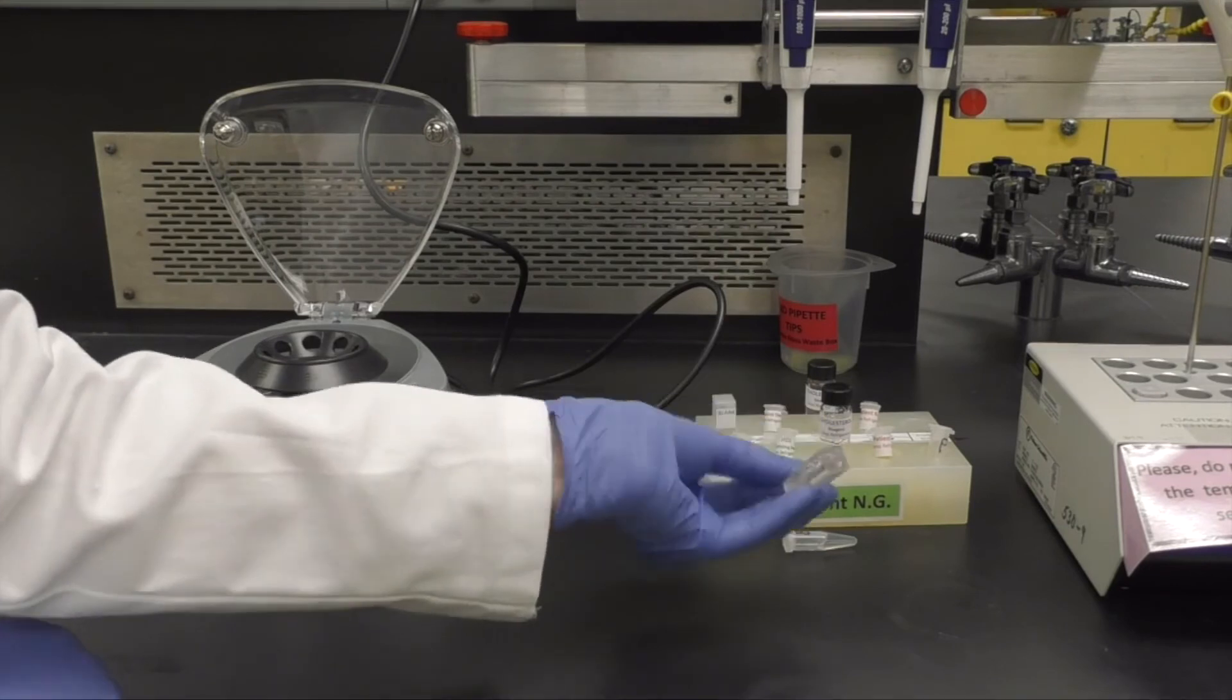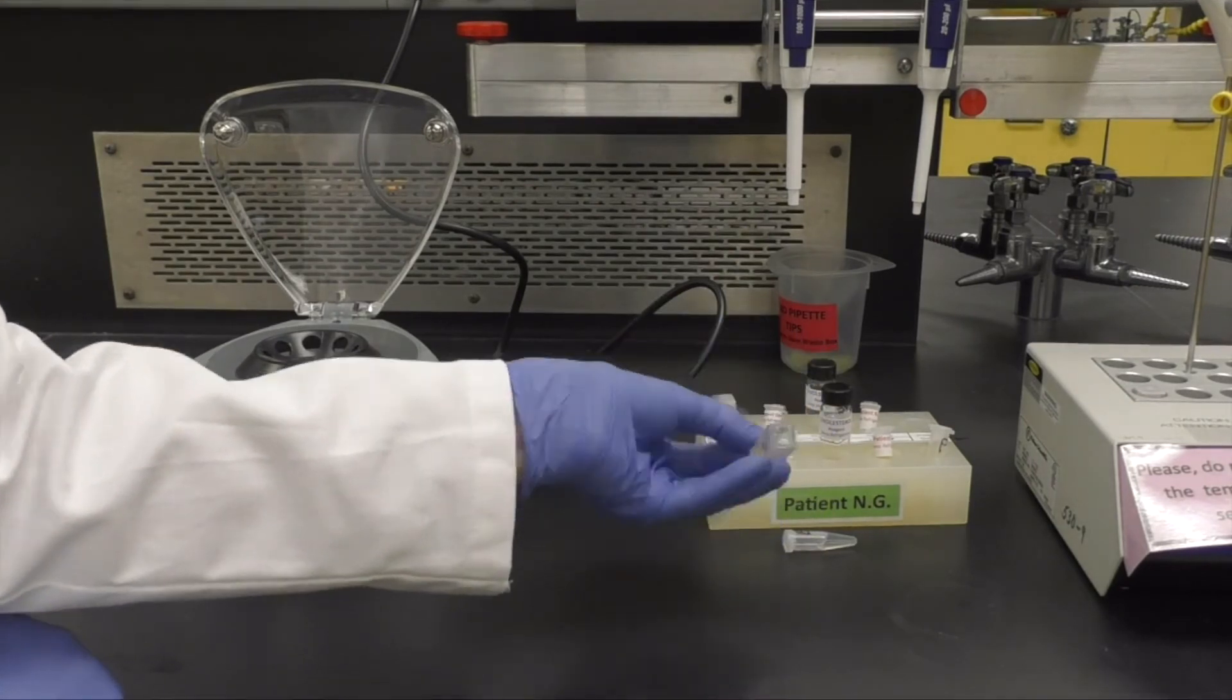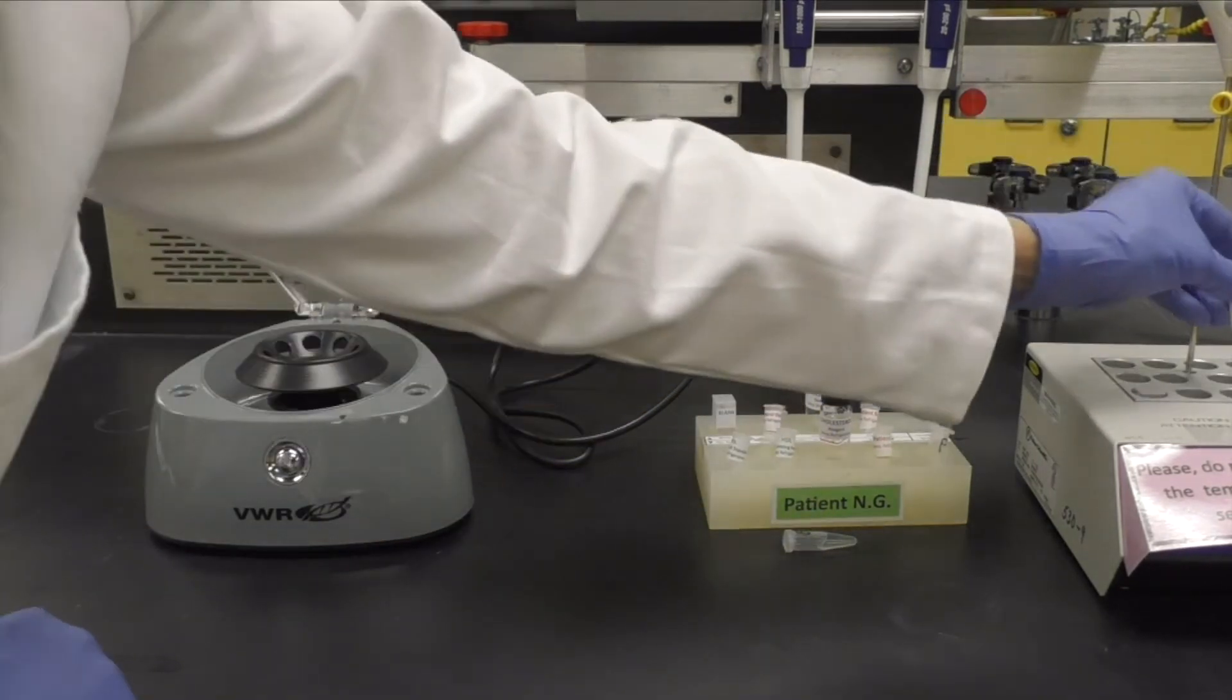While you are waiting, if you haven't already, connect your spectrometer and calibrate it as shown previously in this video.